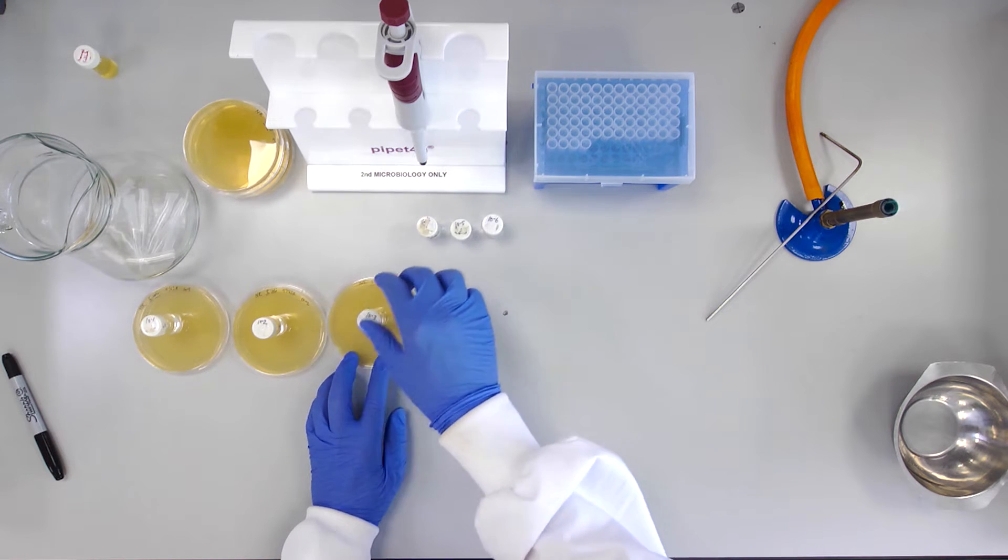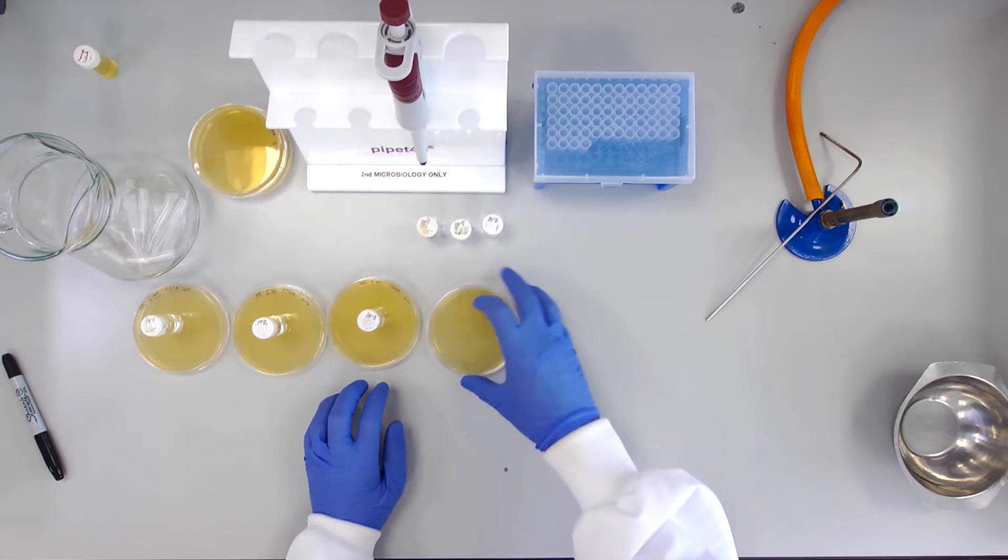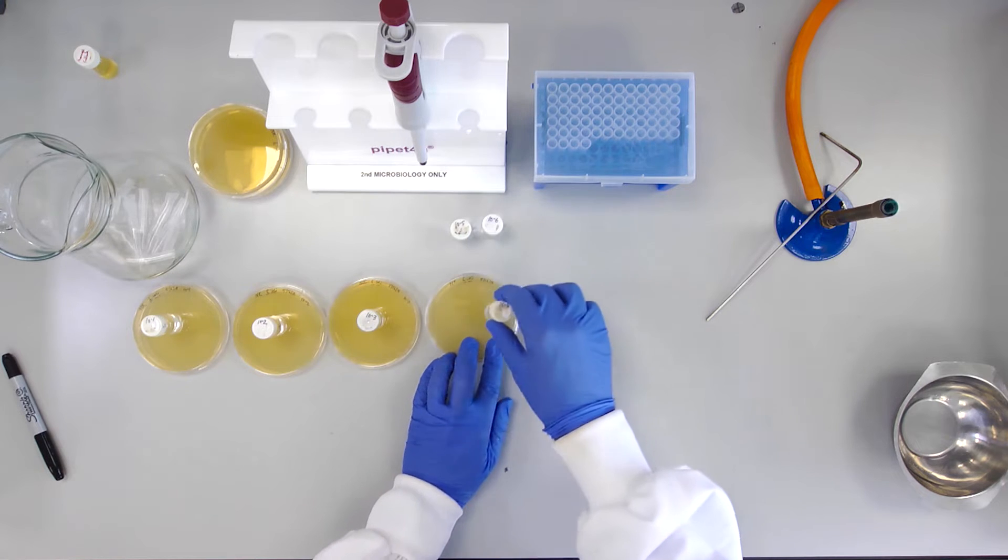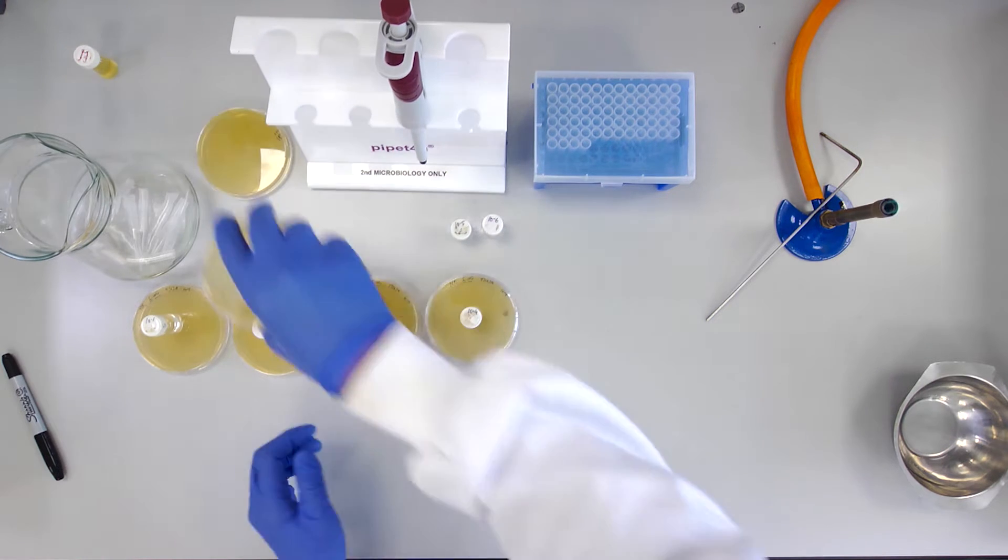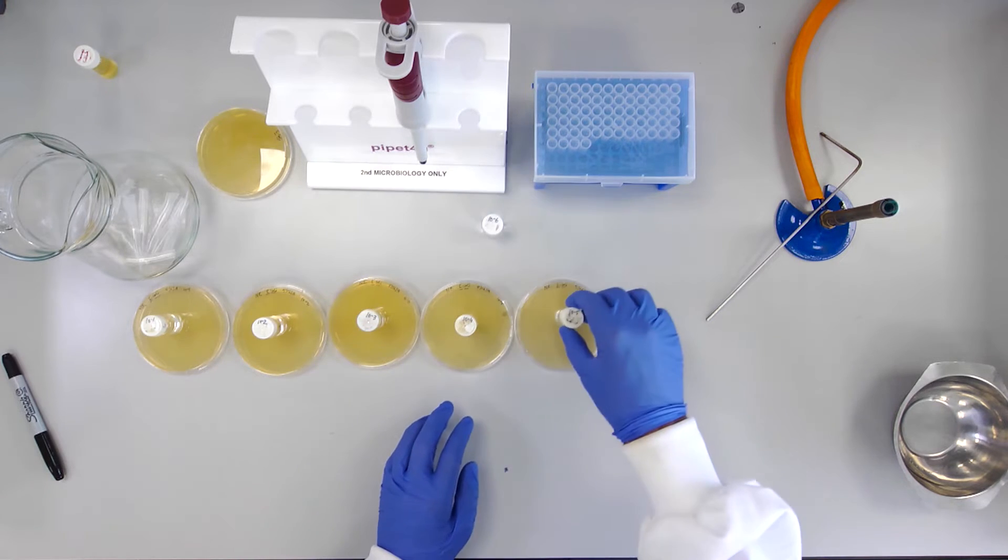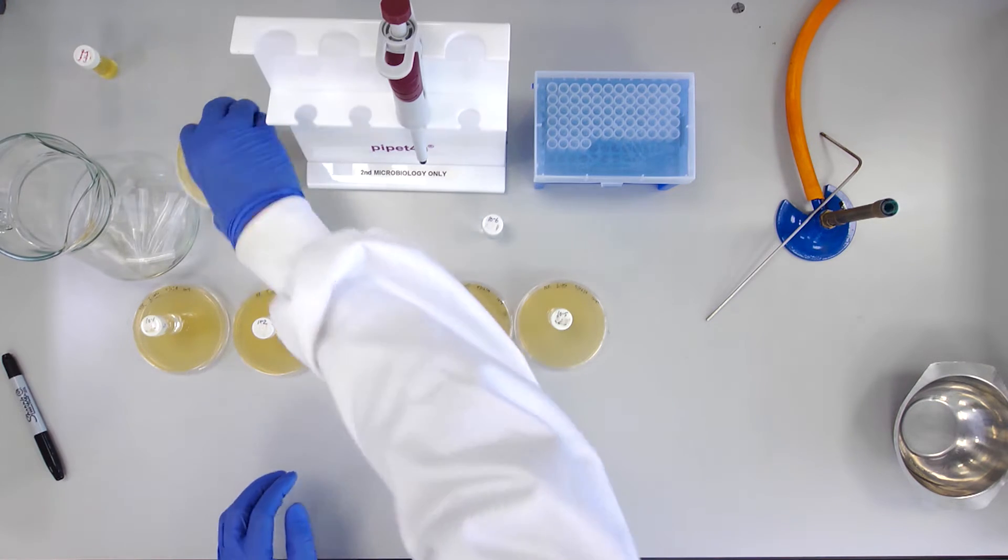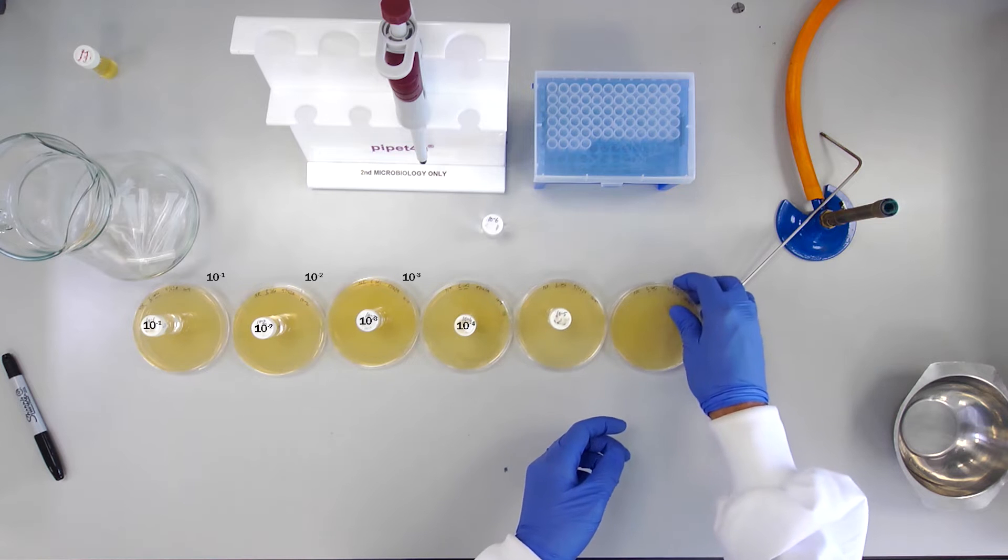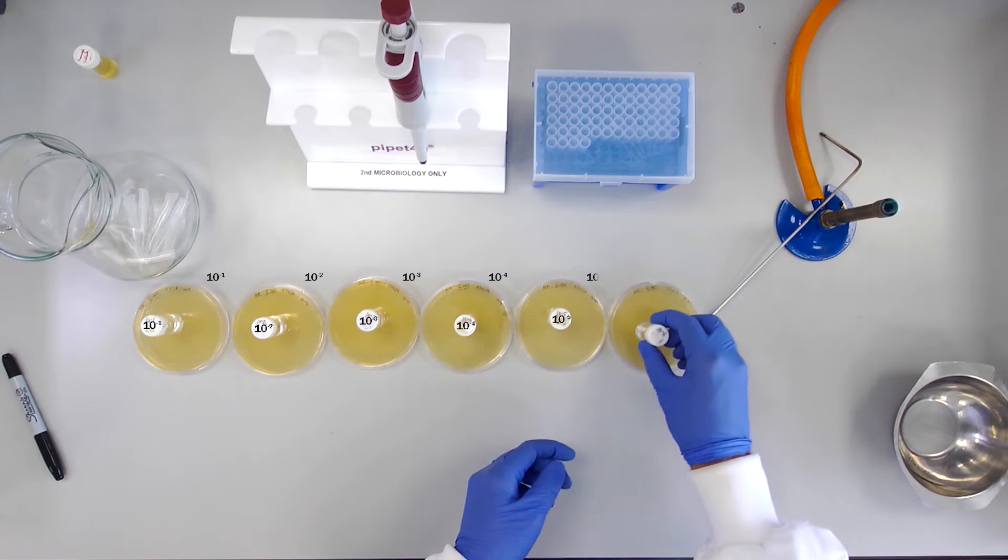For this experiment, it is particularly important that your work area is completely free of paper or other easily flammable materials to prevent the possibility of alcohol igniting such items.